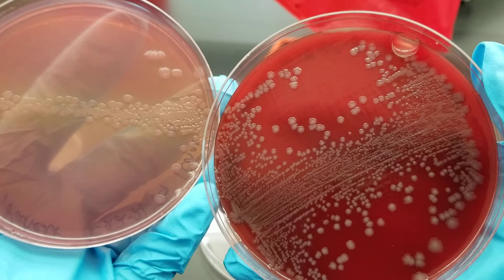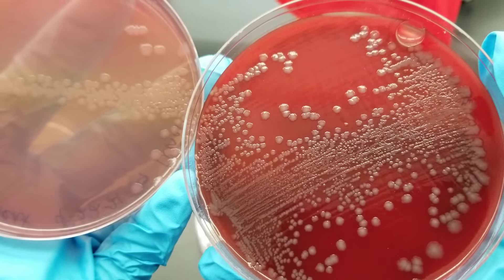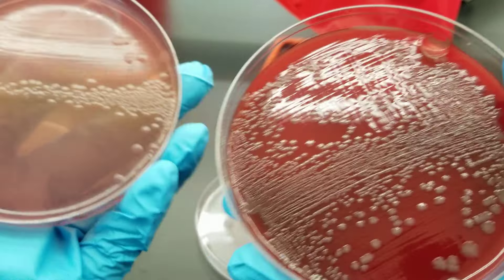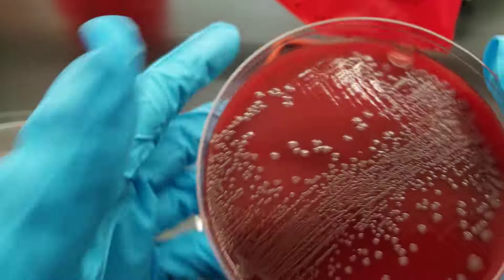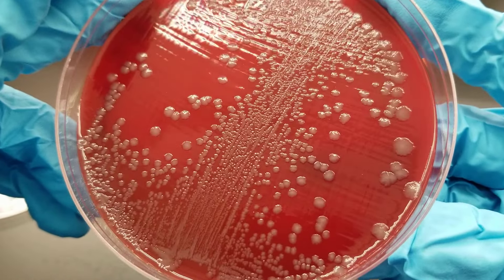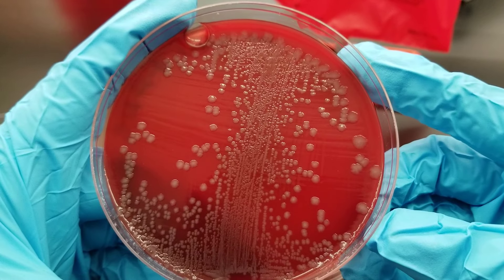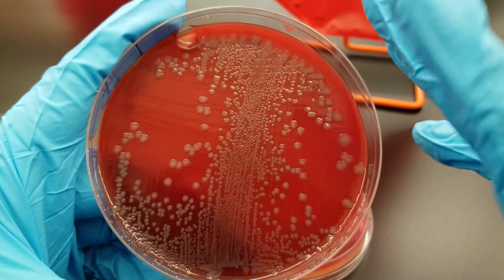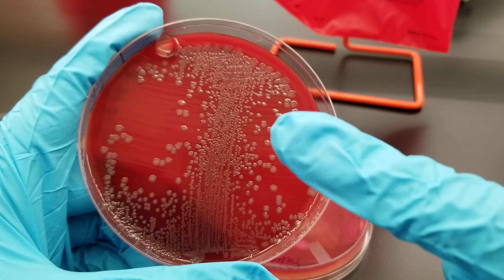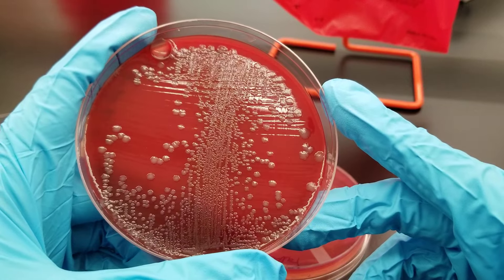It could be from the family Enterobacteriaceae because we do know that they are very common pathogens for urinary tract infection. If I were going to try to count this, I would just say that it's too numerous to count because you don't see all those individual colonies. However, if we took one section and pretended that the plate did have separate, distinct colonies, we could then count them and multiply them by 1,000.